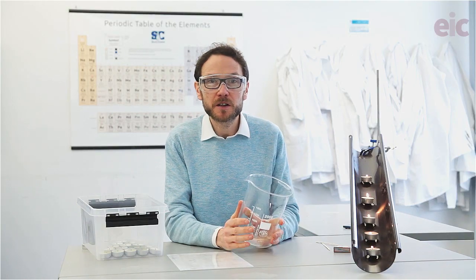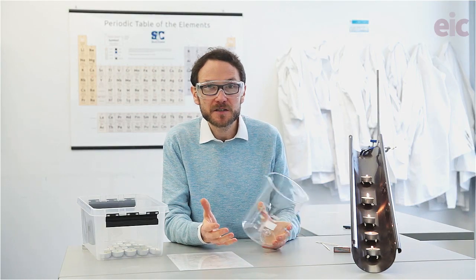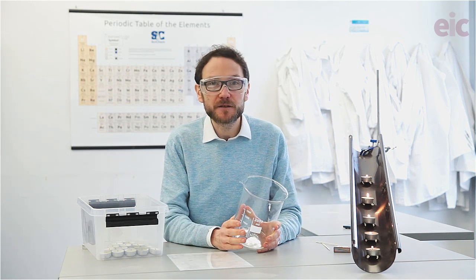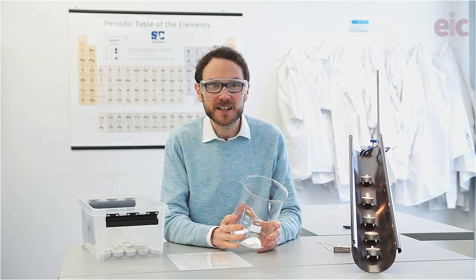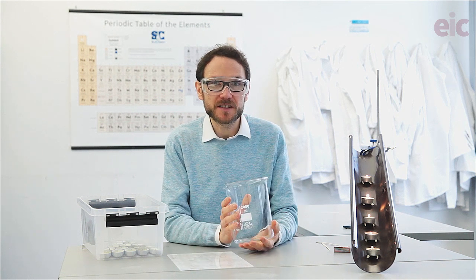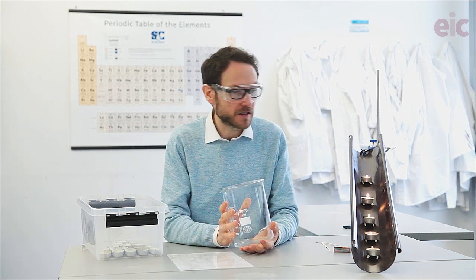And there we go — our candles go out, showing the extinguishing properties of the carbon dioxide and the fact that it's denser than air, as we were able to pour it out of the larger beaker.